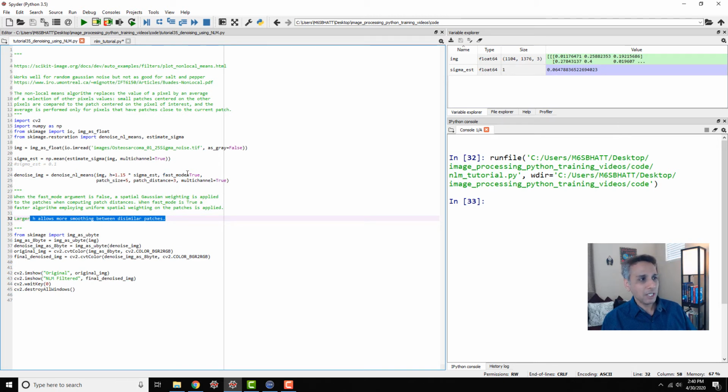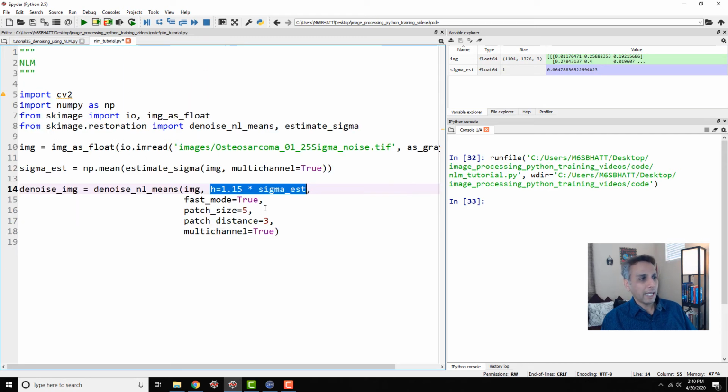And the fast mode: when the fast mode is false, a spatial Gaussian weighting is applied. Again, please read the paper. To me, fast mode equals true means it's actually working faster. I tried it with fast mode false, and the difference in the end result, at least on the images I tried, was so minimal that it wasn't worth the extra time, because it does something extra when fast mode is false. Patch size is 5x5 pixels in this case, patch distance is 3 pixels, and multichannel equals true because we want to apply this to a color image. This is pretty much it.